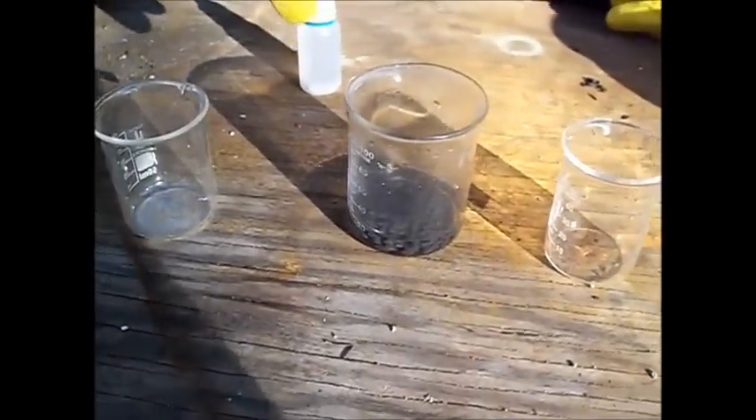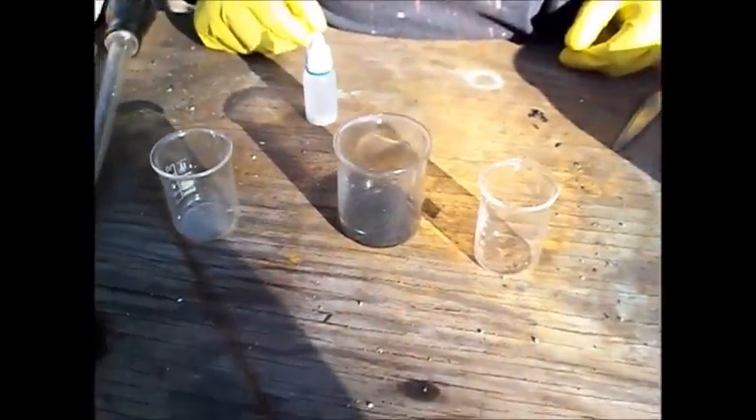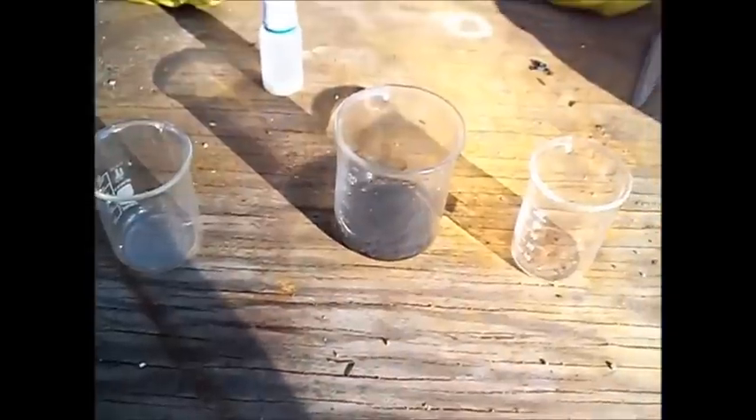The remainder of what's left in the beaker is undissolved tin from the solder and the antimony that doesn't dissolve in hydrochloric acid. The solution is clear now, and I'm going to swirl this around and show you what happens when I stir it up. The antimony is swirling around and the solution looks black. Just like that, the antimony has settled all to the bottom and the solution is as clear as water. The antimony is very heavy and dense, it settles quickly, it doesn't dissolve in hydrochloric acid, and it doesn't contaminate the test solution whatsoever.